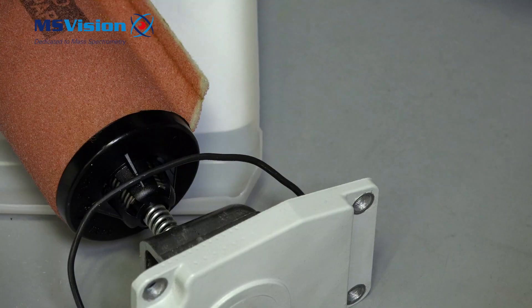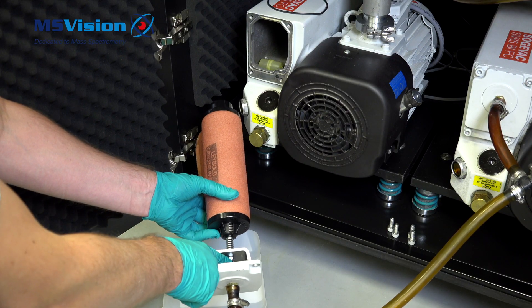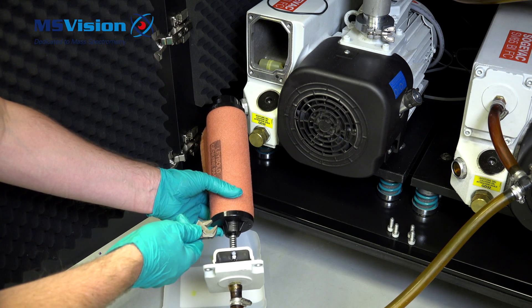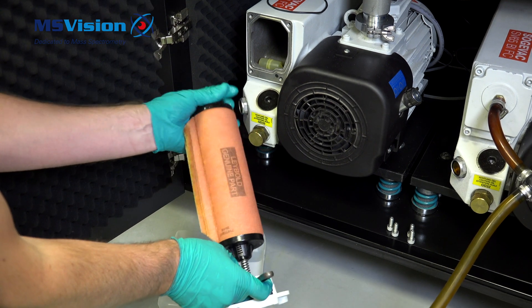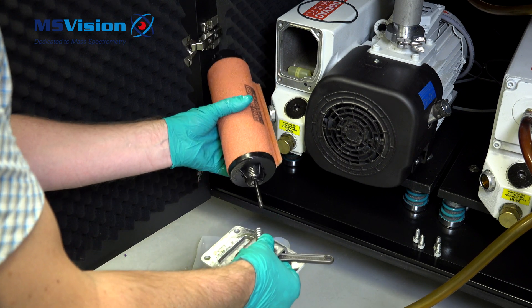The gasket should be here when we reinsert the new filter. We have a spring and a nut behind the bracket. Use a 10mm spanner to hold the nut and turn the filter by hand. Be careful not to drop the nut or spring.